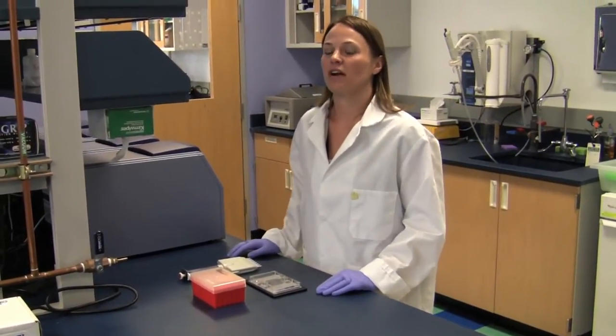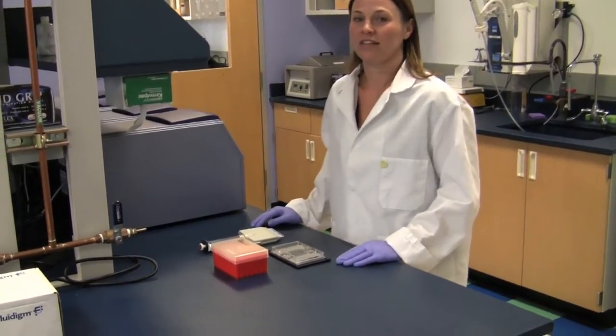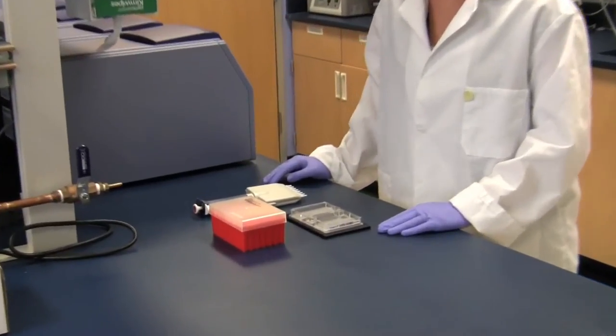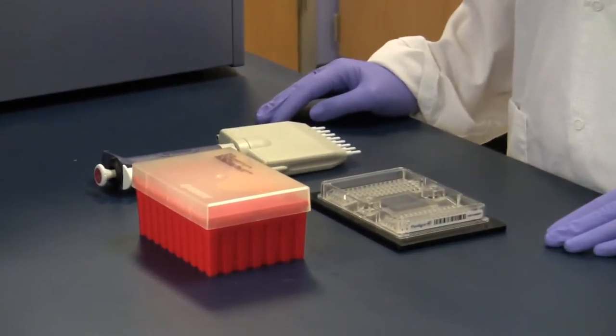So what we have in front of us here is one of our high-density 96.96 dynamic arrays. I'm going to demonstrate how to load your samples and assays into the chip.